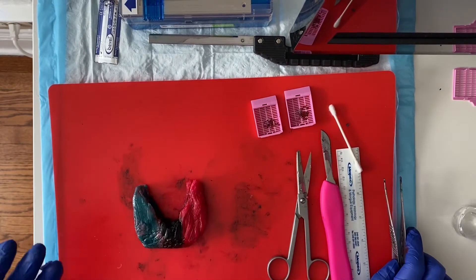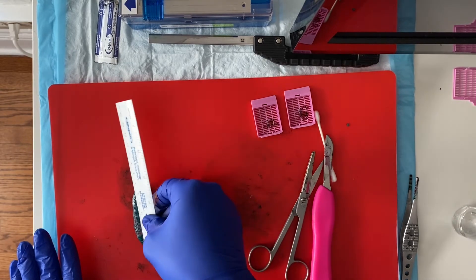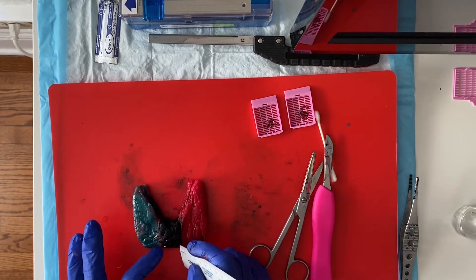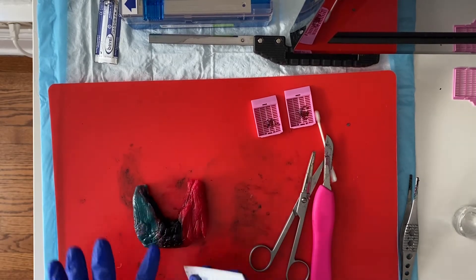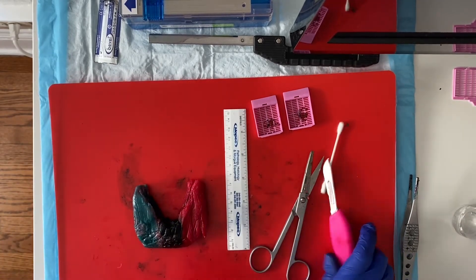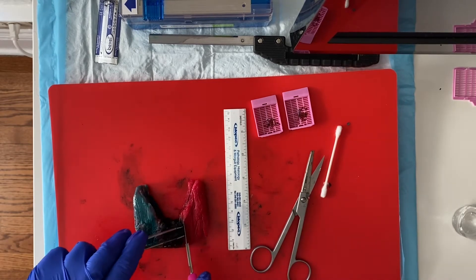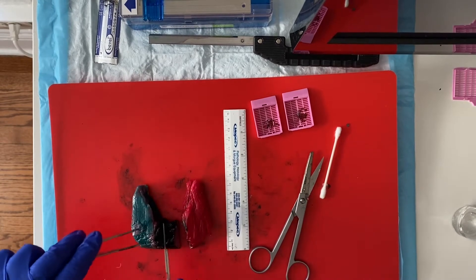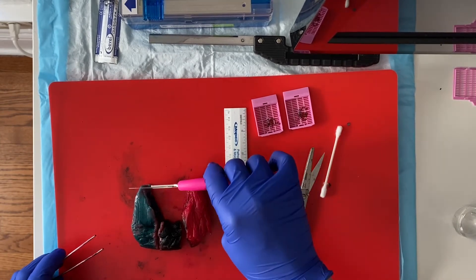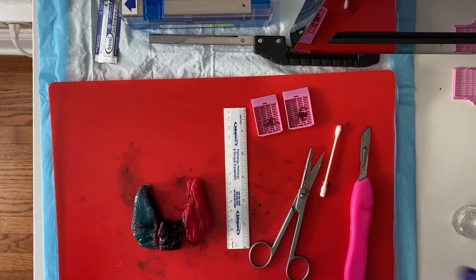We've described our outer surface. We're now going to measure each of the three components in three dimensions: one, two, three for my right lobe, same for my left lobe, and my isthmus. Where your isthmus ends and your lobes begin is somewhat arbitrary, but take measurements where you designate your ink boundaries. If you had a pyramidal lobe, you would measure that separately in three dimensions. To serially section this specimen, I'm going to amputate my right lobe, left lobe, and isthmus and section them each individually — the lobes superior to inferior, and the isthmus from right to left. I'll lay them all out individually and we'll pick it up there.